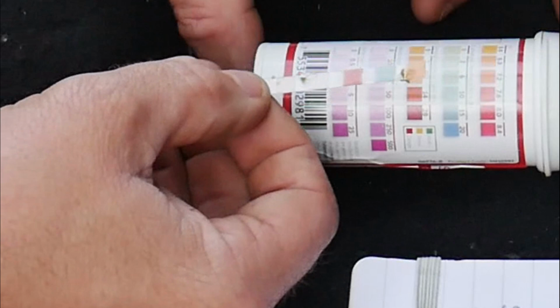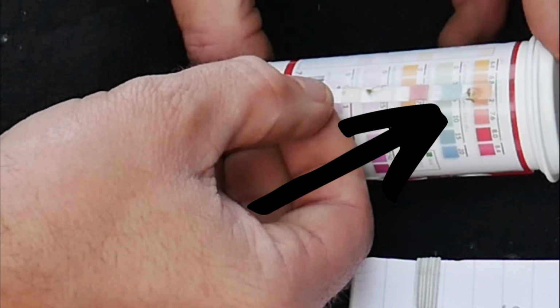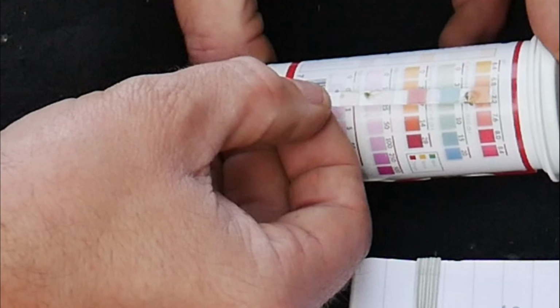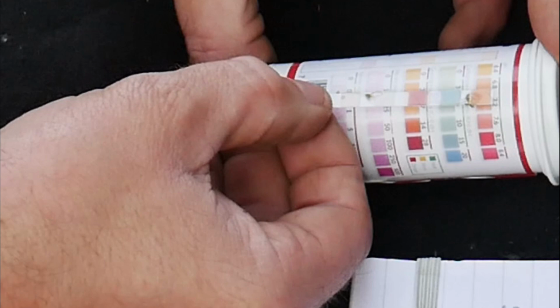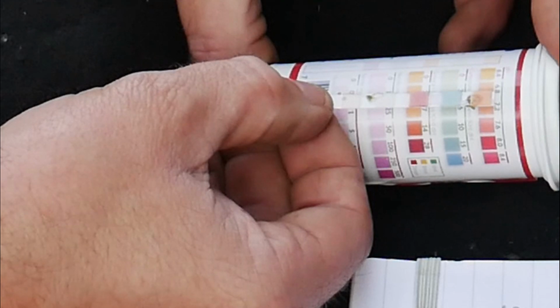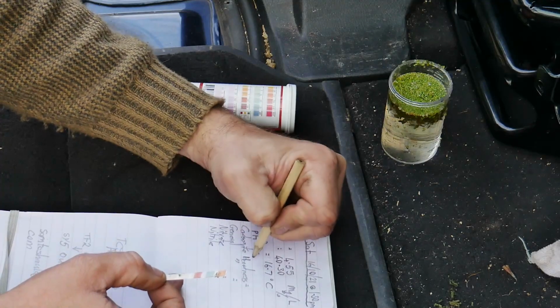You can see that the pH is somewhere in the region of 7.2 to 7.6, so spot on ideal conditions. The carbonate hardness is between 6 and 10, towards the limit of the ideal range, or possibly just above. This should provide a great buffer against wild swings in pH, and I'm quite happy with this. The general hardness is somewhere between 7 and 14, and probably closer to 14 than 7. This is slightly higher than the ideal range, but again it's within the maximum acceptable limit of 250 parts per million, so I'm happy with that.